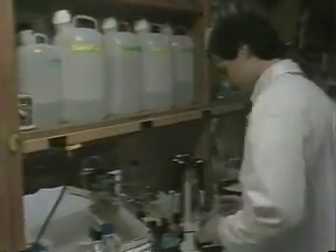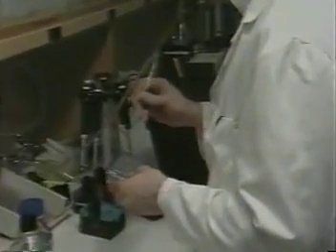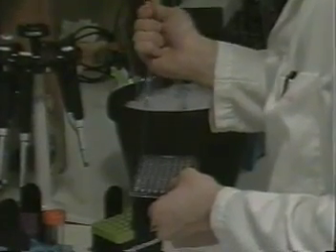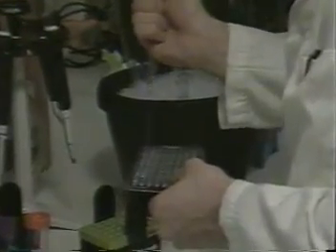After an appropriate incubation period, Tom spins down his samples. He then aspirates the supernatant, leaving a pellet of cells at the bottom of the well. Now he taps the plate to loosen the pellet and resuspends the cells in staining medium. Next, Tom will stain the cells with second step reagents and wash them again.